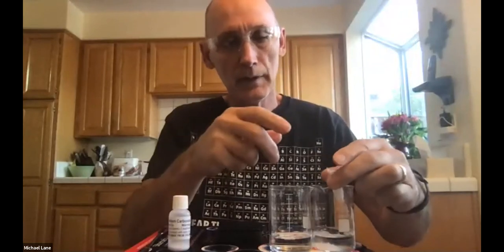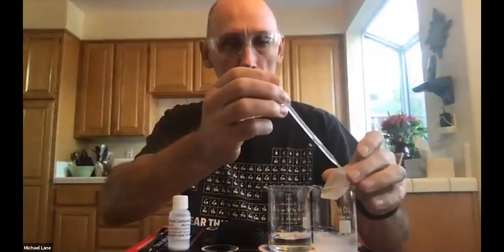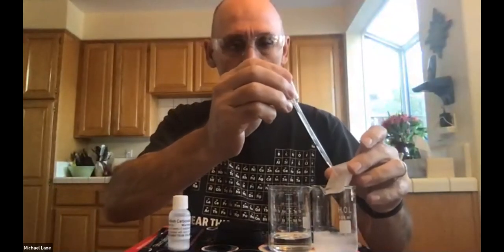Now, this goes in there. Use some caution to make certain that everything that ends up in here, note that I'm kind of holding it in there and just tapping on it a little bit. There we go. Now you can see maybe there's a little bit of residual in there. So I'm gonna just get a little bit of water and wash that down in there. And I say, well, that's now giving it more than 25 milliliters of water. Well, it is, but as I said, that's not particularly relevant. Now, so at this one, I've got 1.47 grams of calcium chloride, and we'll get that dissolving. Right, we're just going to get that dissolving.